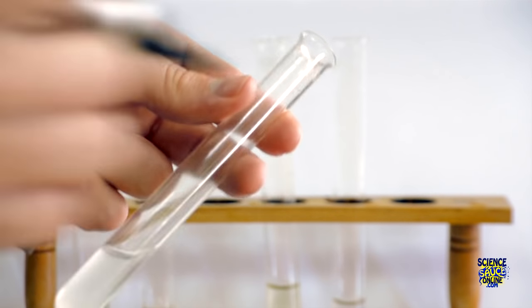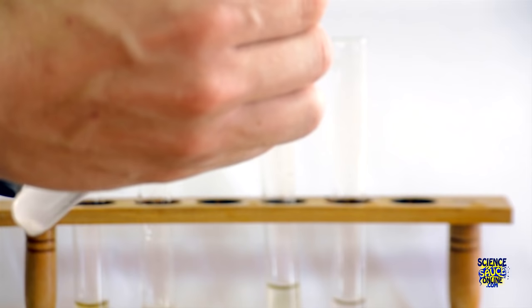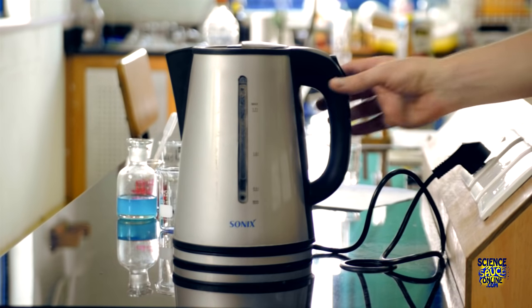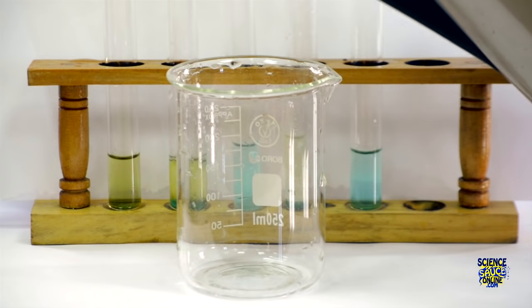It's a good idea to label each of your samples for this test because you're going to need to put them into a water bath and they might get mixed up. For your water bath there's a number of ways to do it but the easiest way is to just boil the kettle and fill up a beaker with hot water.